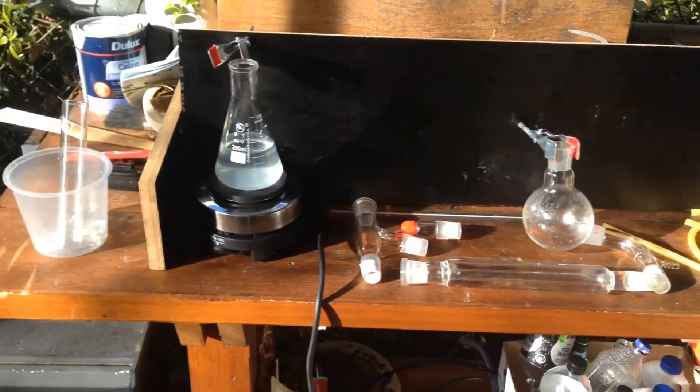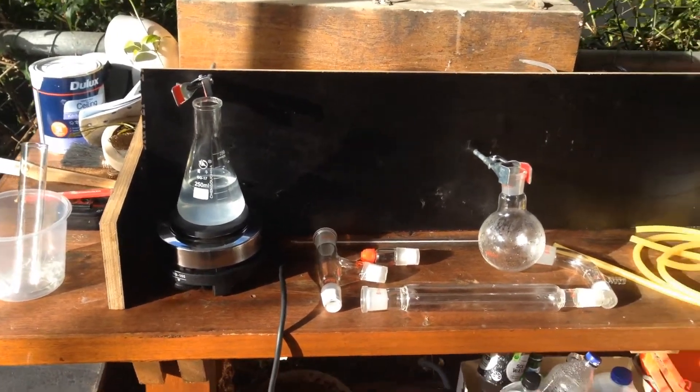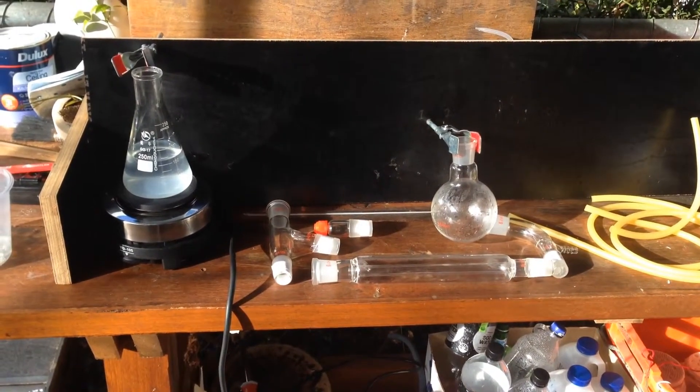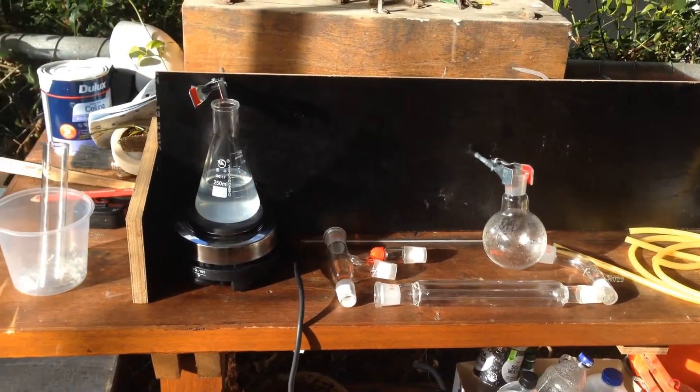So I recently got a distillation set and a hot plate, and so I thought, for starters, we might try a purification of water by the distillation of some salt water.